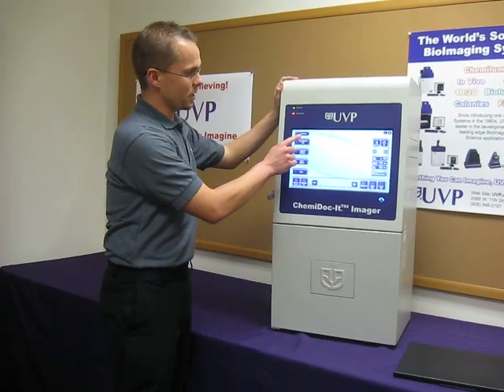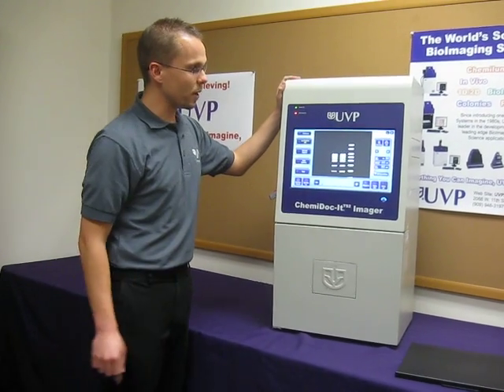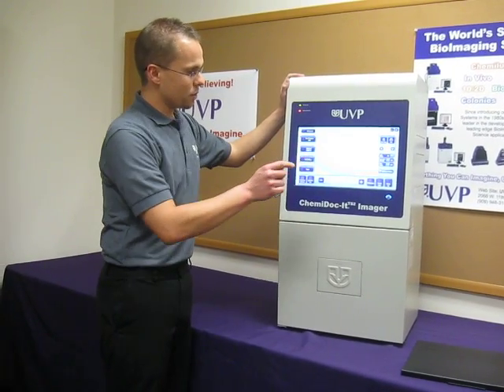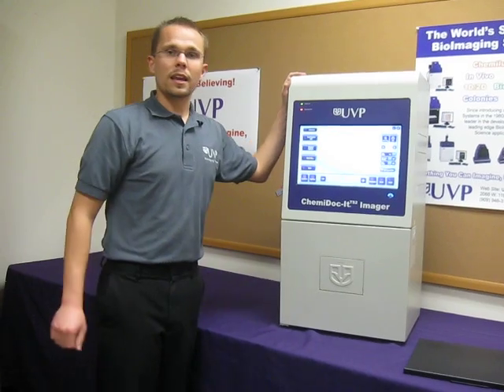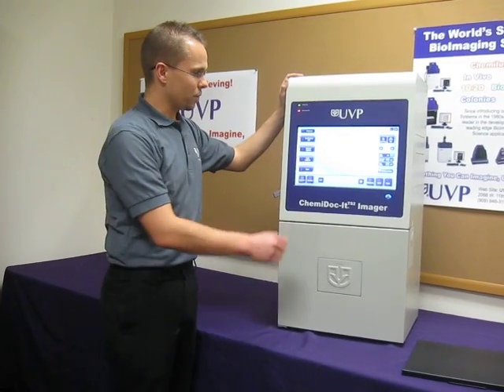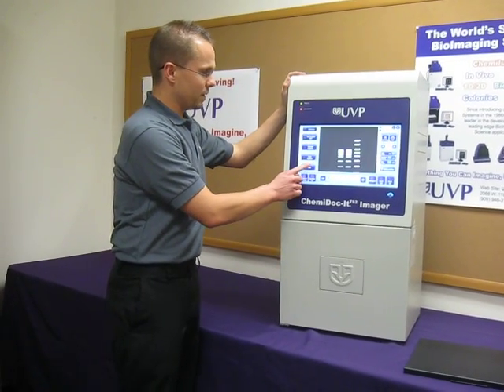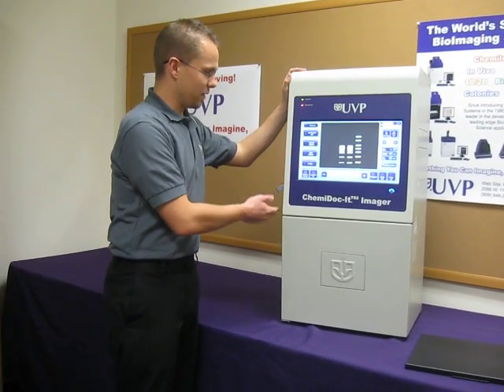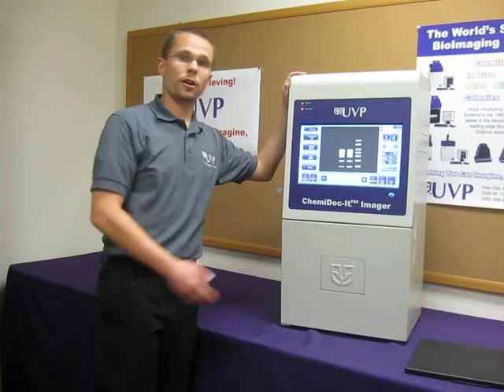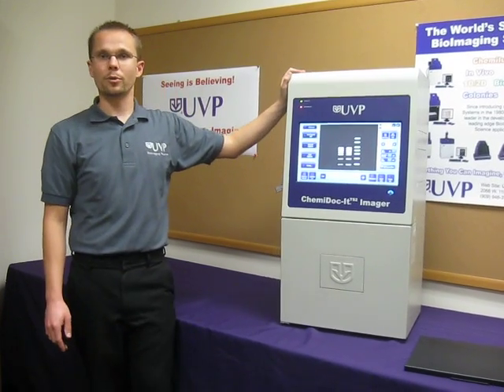First, you press the Live Preview button to preview your image, press the Auto Capture button, and then once capturing is complete, you simply press the Save button to either save it to the USB stick or to a wired or wireless network.